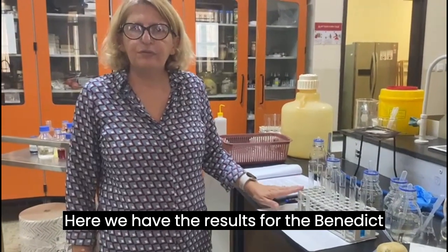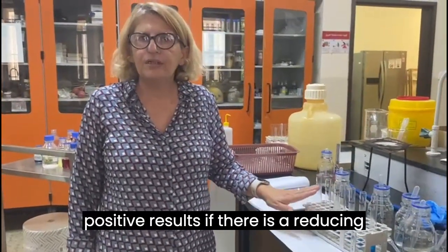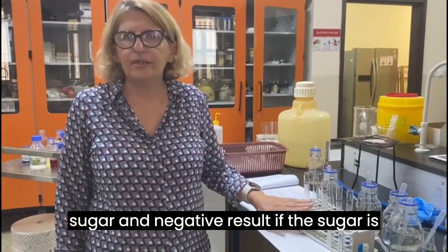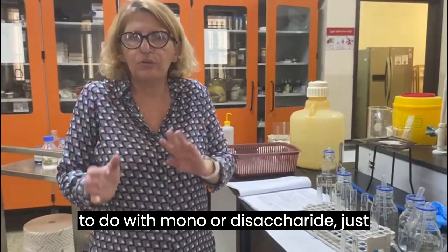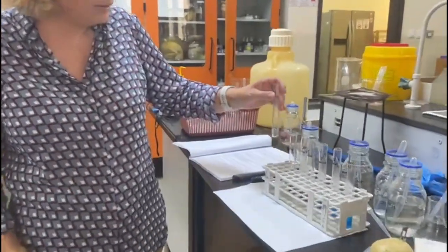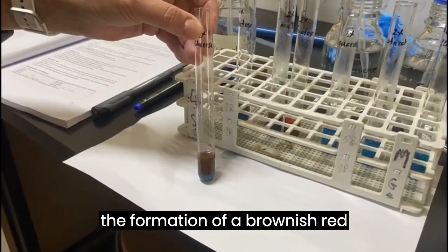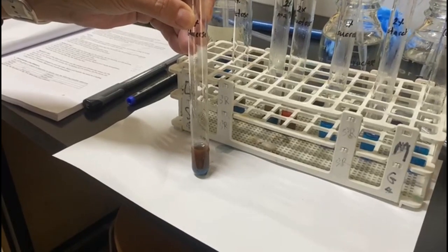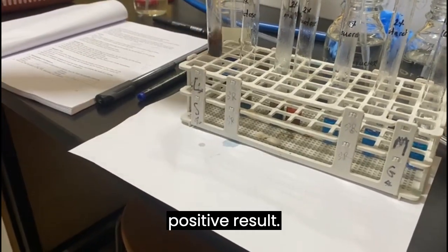Here we have the results for the Benedict test. We are seeing a positive result if there is a reducing sugar and a negative result if the sugar is not reducing. So it doesn't have anything to do with mono or disaccharide, just with the reducing or non-reducing. Here we have 2% glucose. You see clearly the formation of a brownish red precipitate, which indicates a positive result.